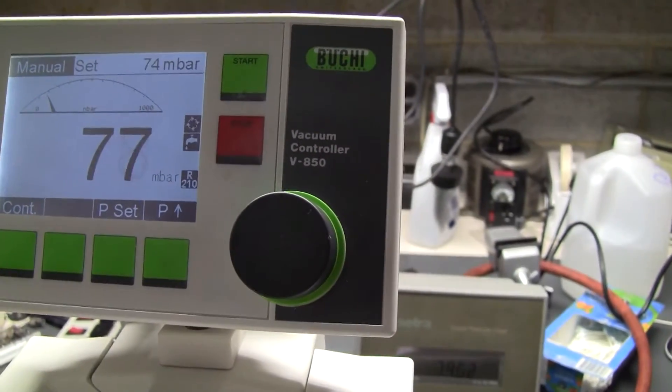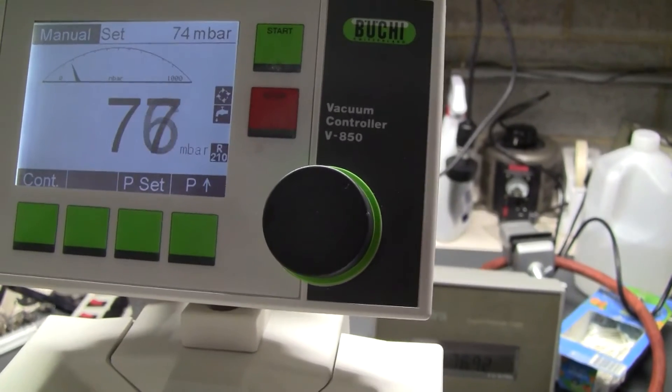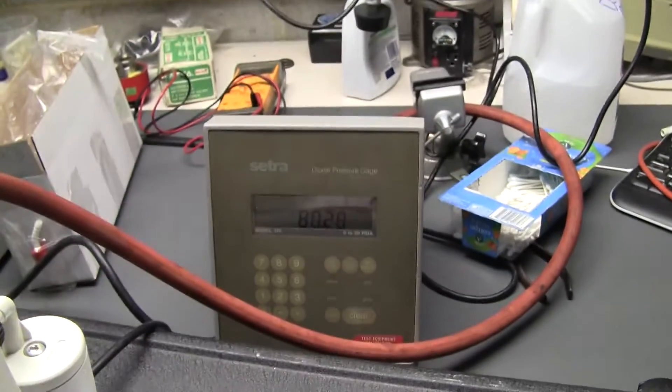Release, vacuum, release, vacuum, release, vacuum. And you can see it's also trying to do it back too.